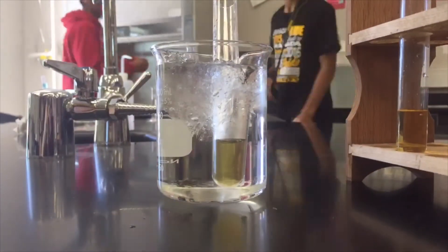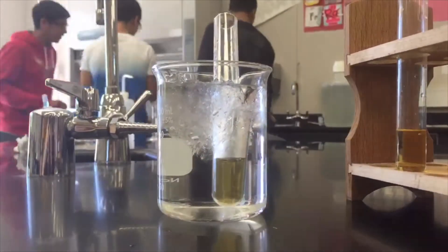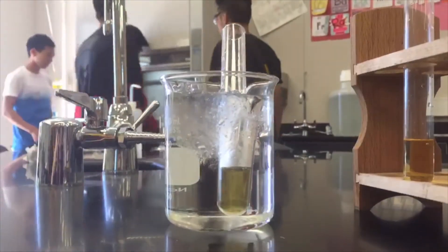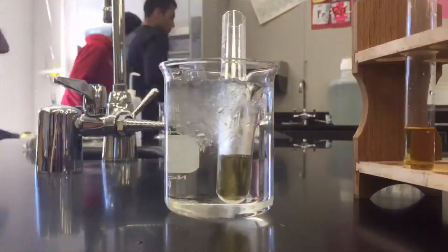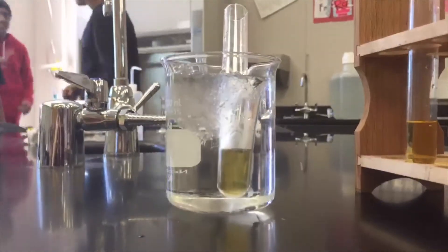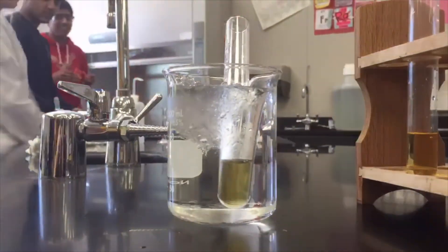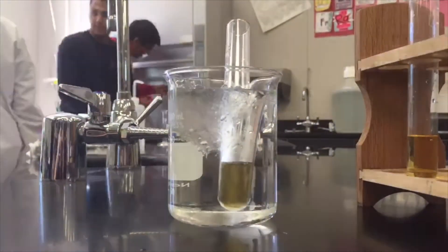After three minutes, we compared the two tubes and found that there was no change. Then, we placed the experimental tube in an ice bath. After three minutes, we compared the experimental to the control, and there was again no change.